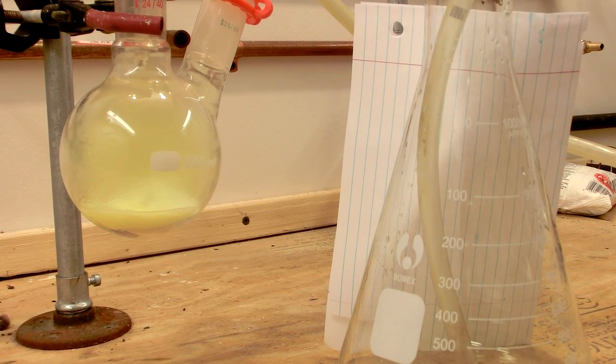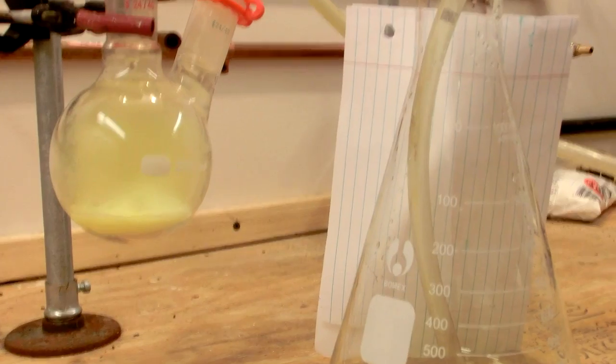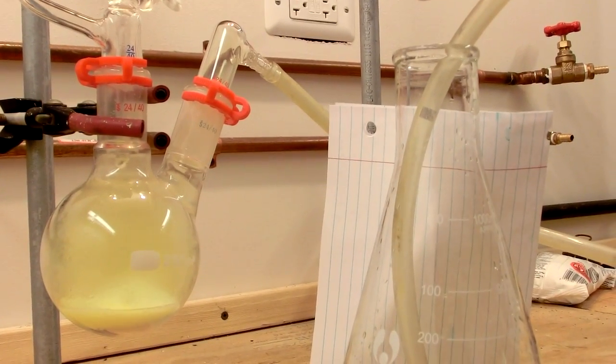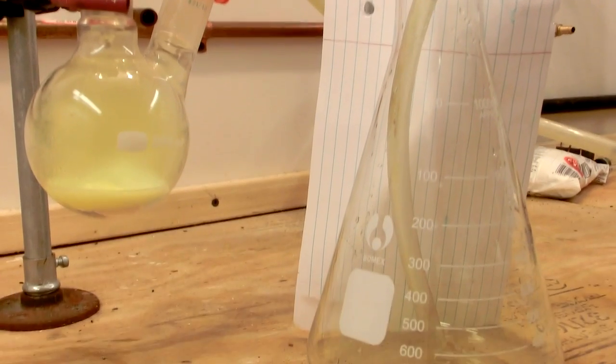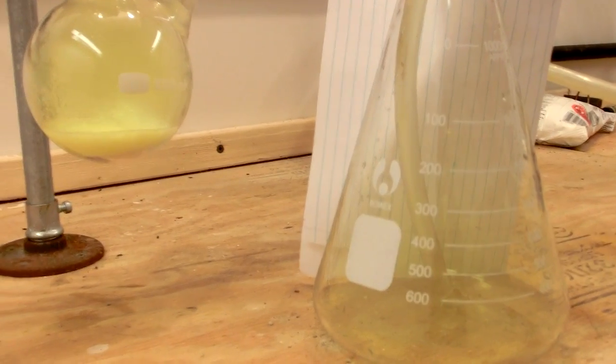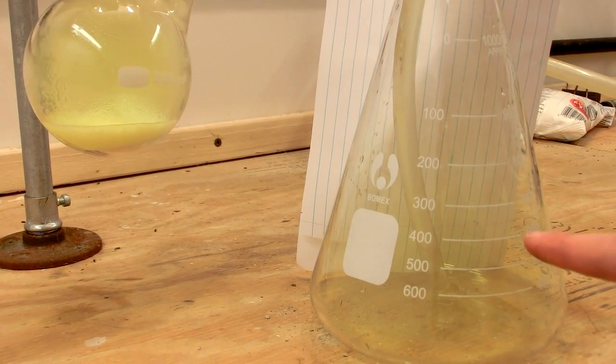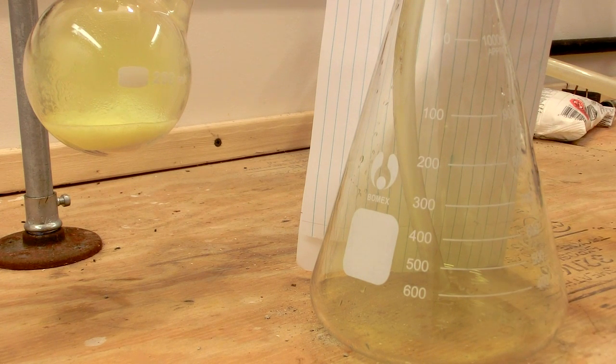Now unless you're using ventilation like I have, which is very strong ventilation, you definitely do not want to do this experiment indoors when the top of this flask is just open to the air because you will be getting a significant amount of chlorine in the room. You can see the green slowly filling up the flask.